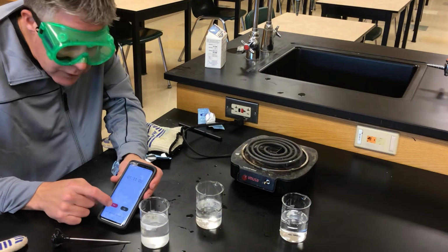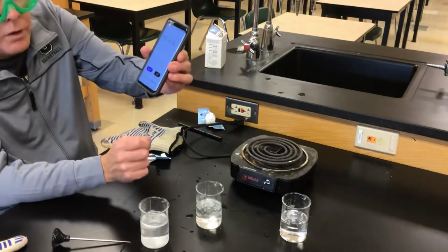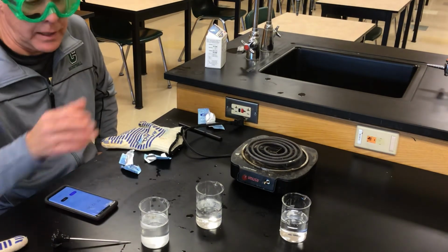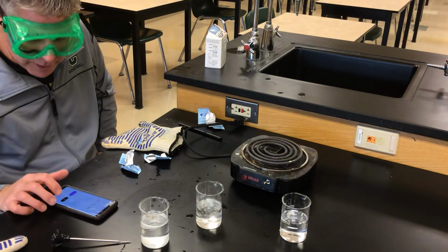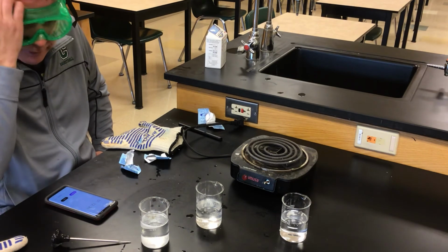And it looks like it's about done there. So at 1 minute, 12 seconds, which we would write in our notes because we kept these in seconds, we would have to keep this in seconds. So we'll keep that in mind. All right, I'll give you the rest of the data after we finish the lab.